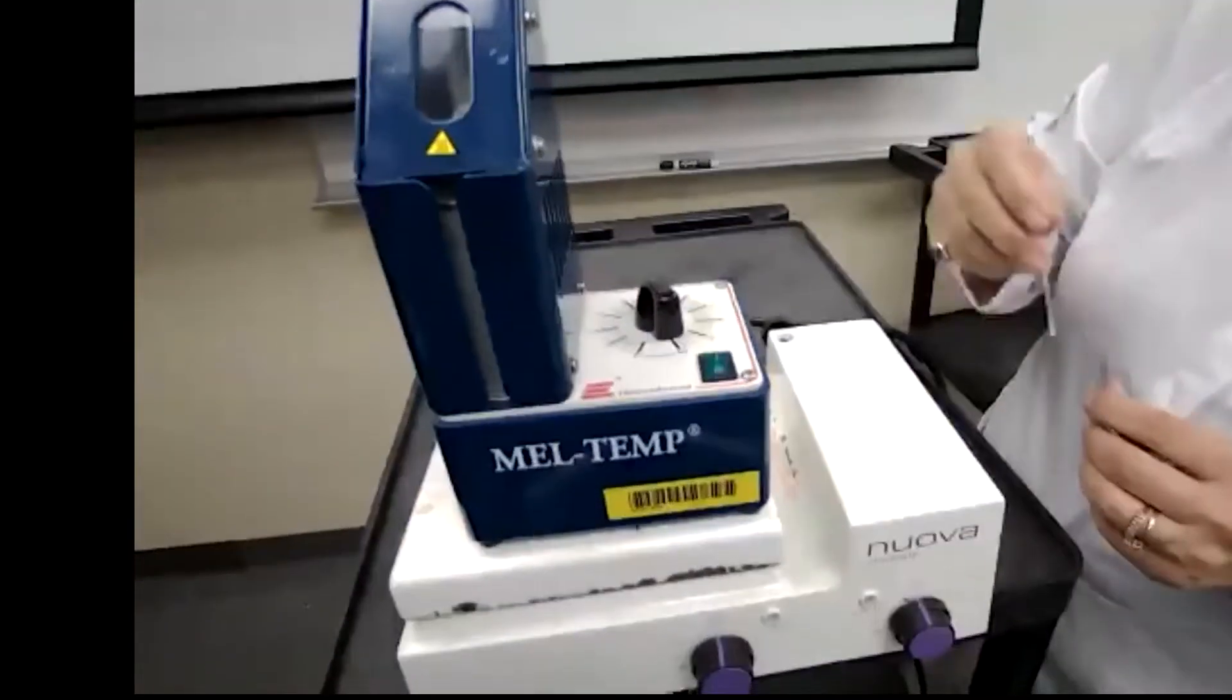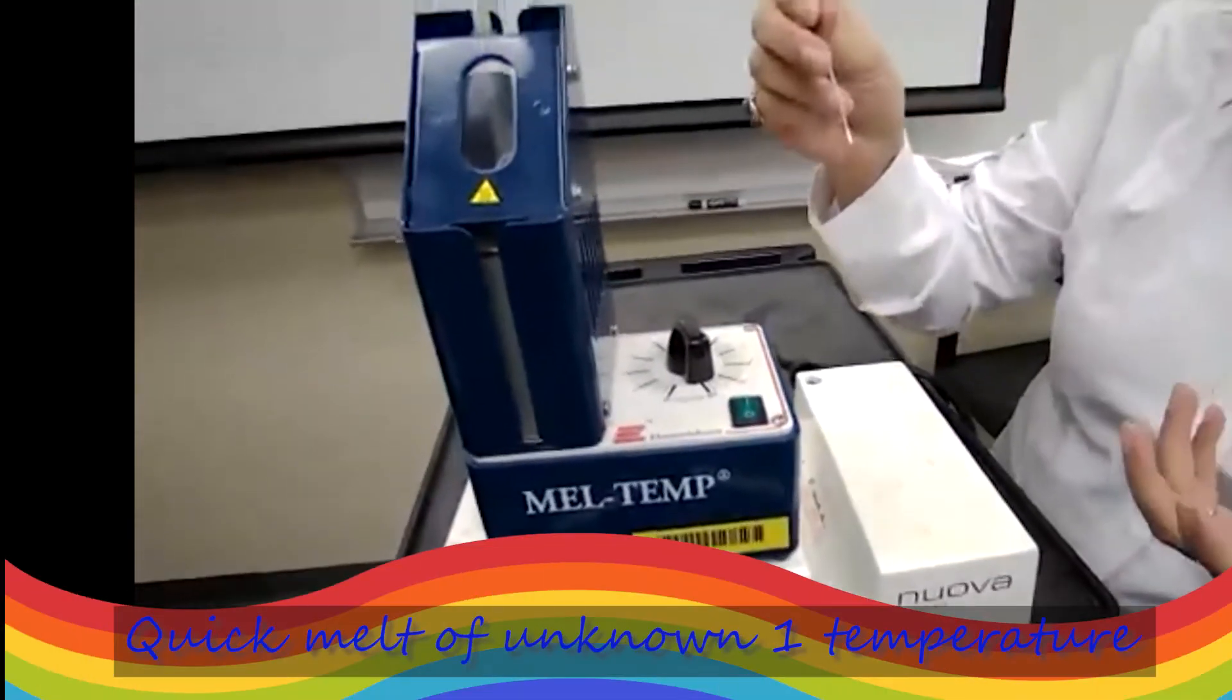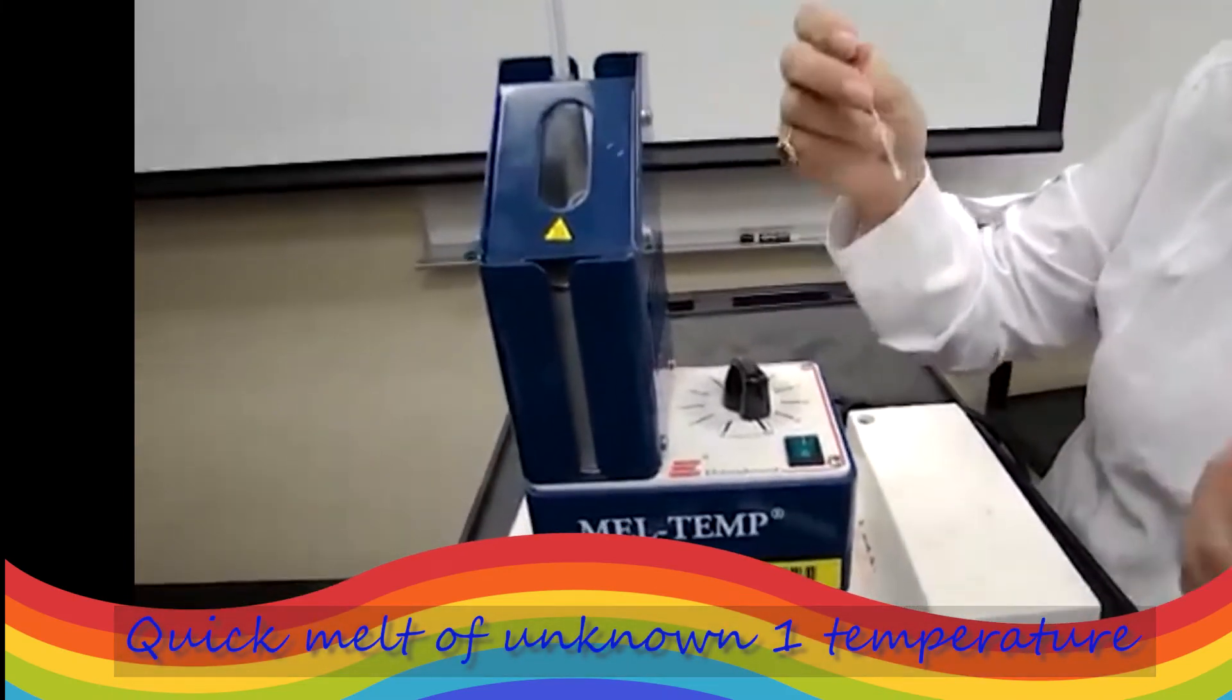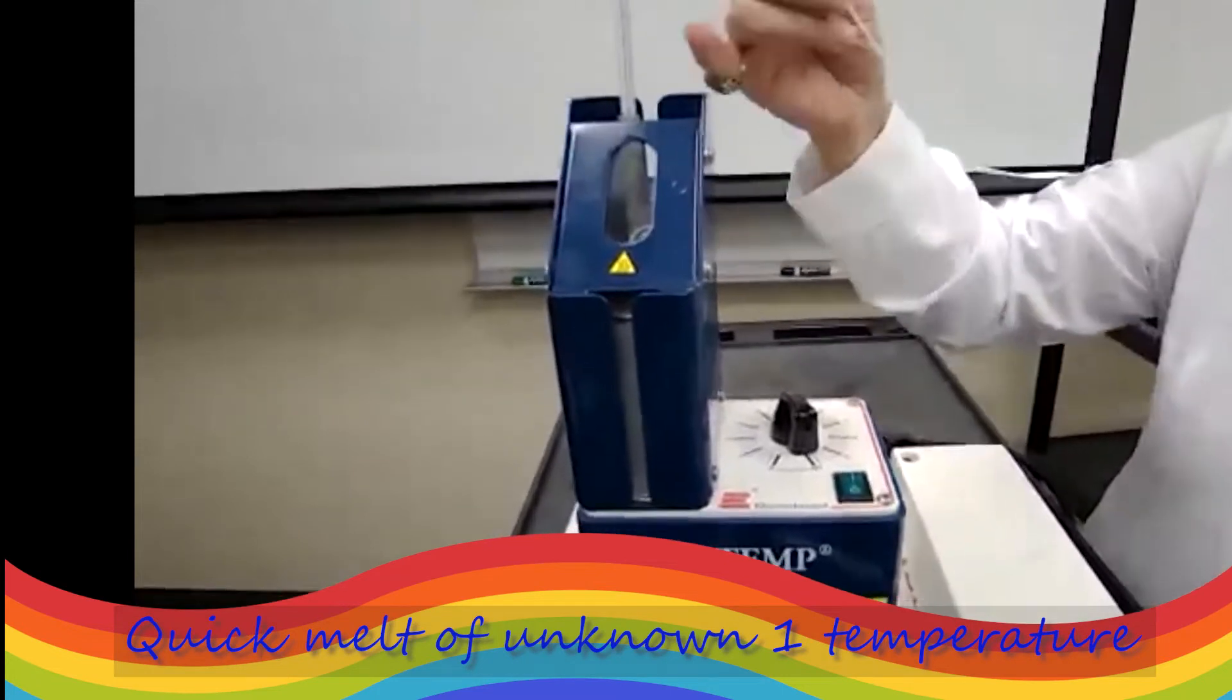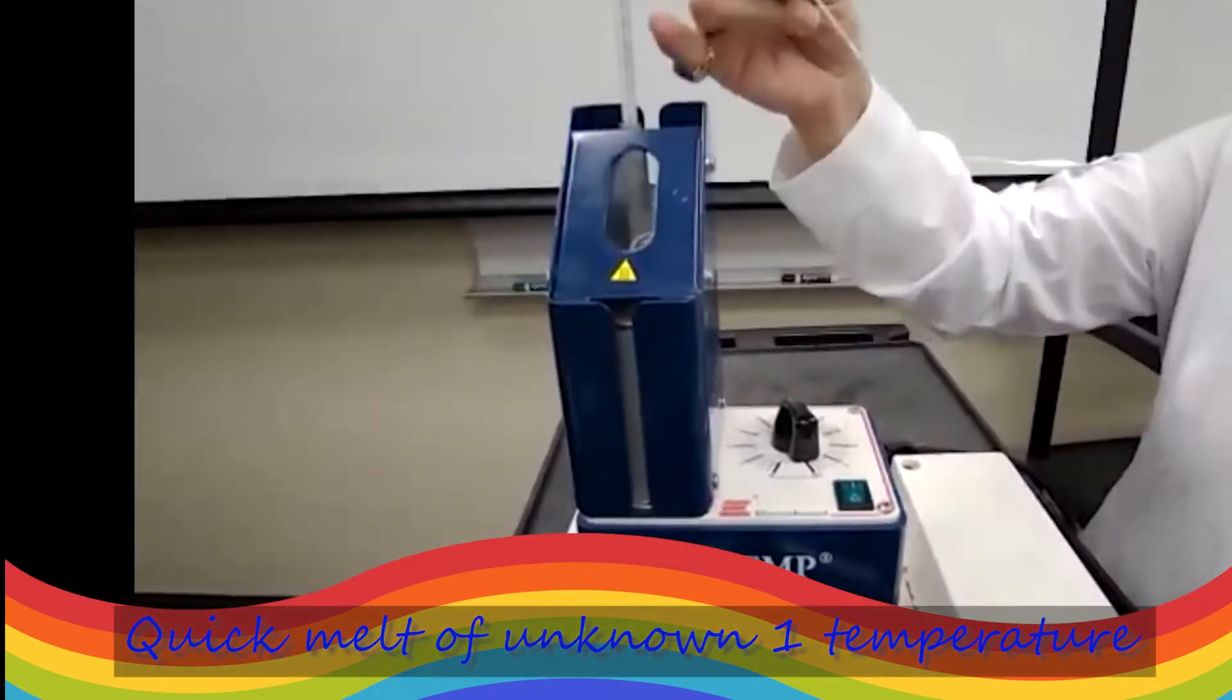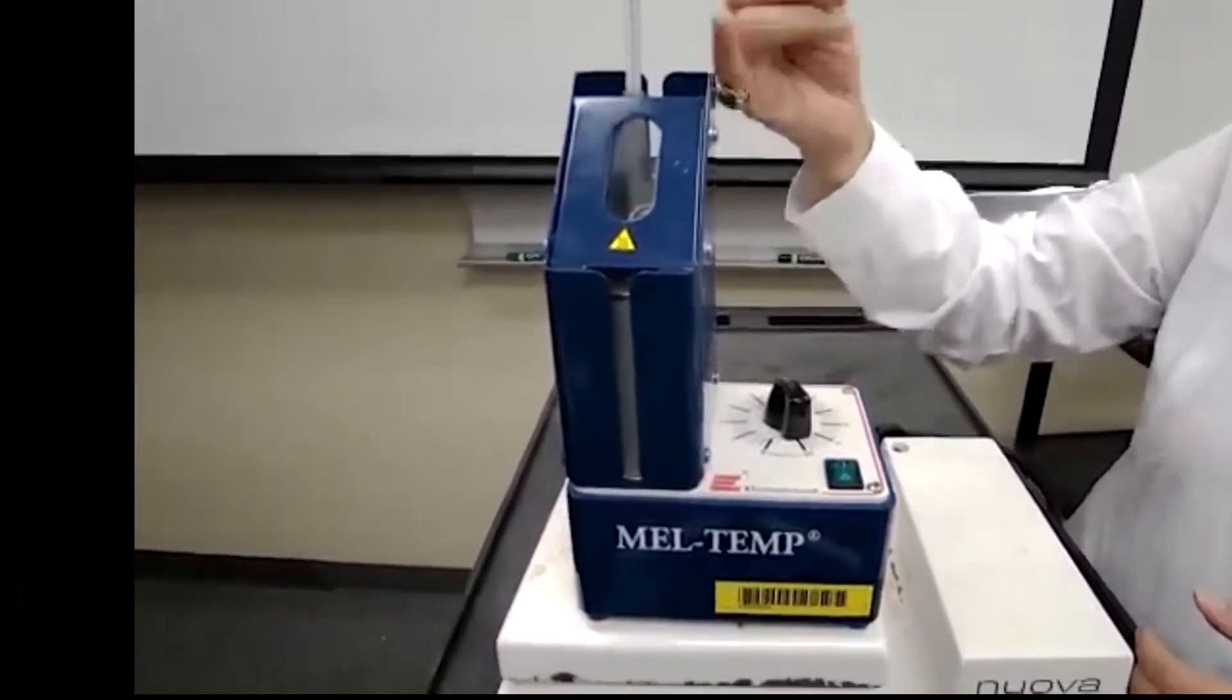We have an idea that the sample is going to melt somewhere around 140 or higher because I was heating fast. So the temperature thermometer didn't have time to show me the real temperature.